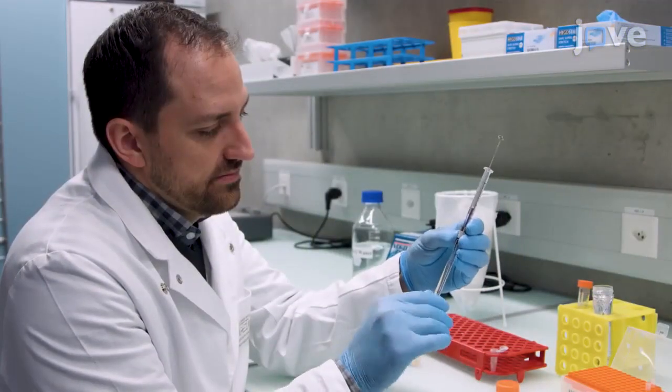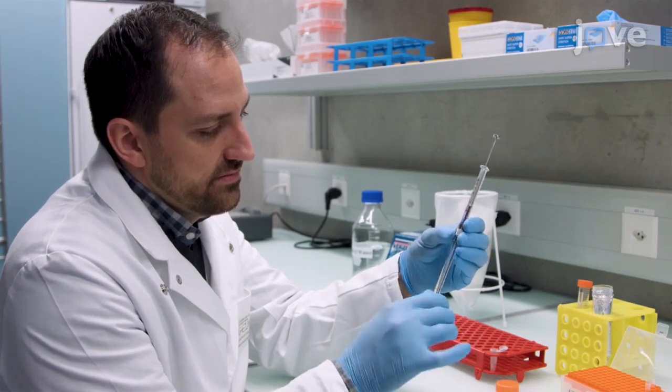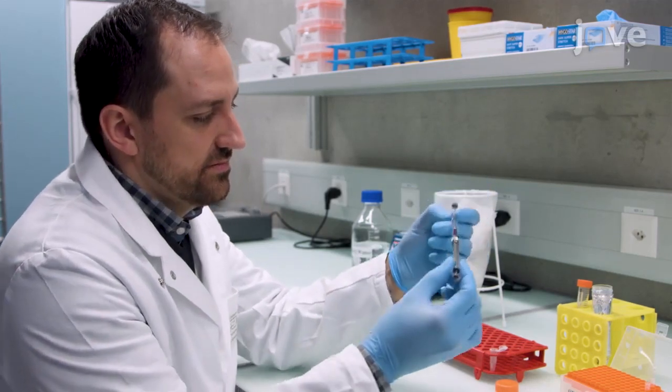Connect the sample syringe to the syringe coupler, taking care not to introduce any air into the sample.